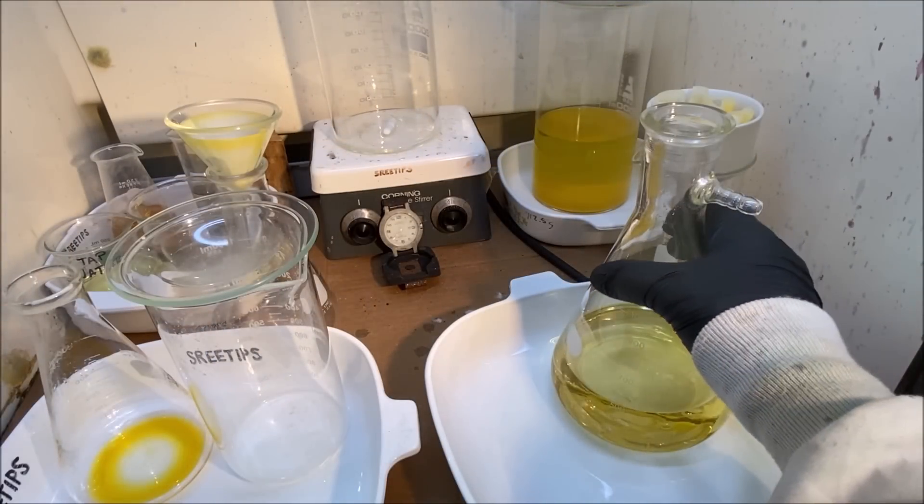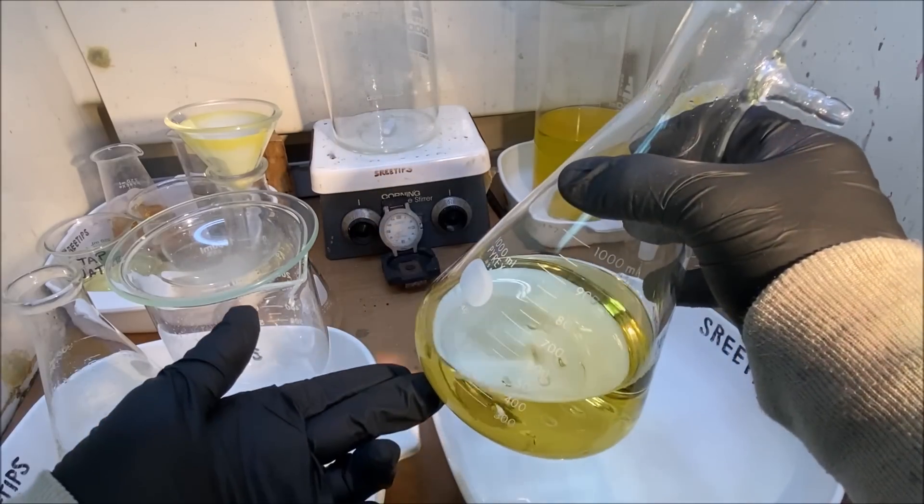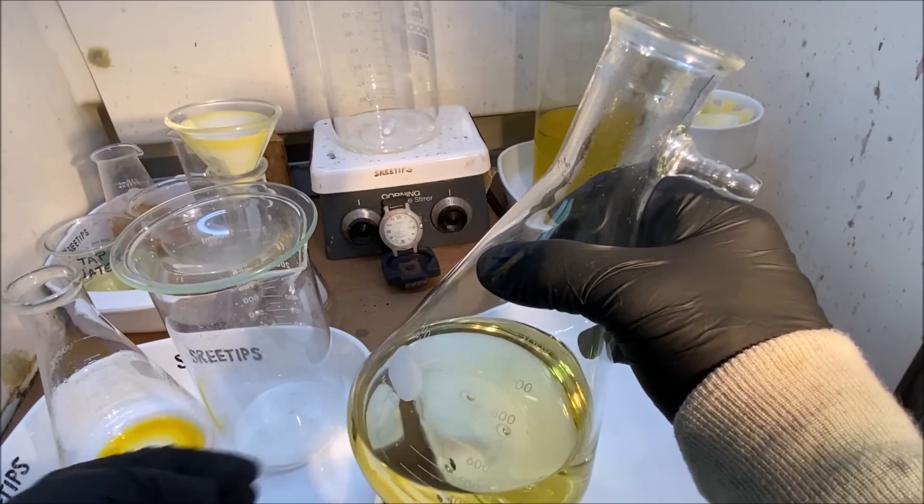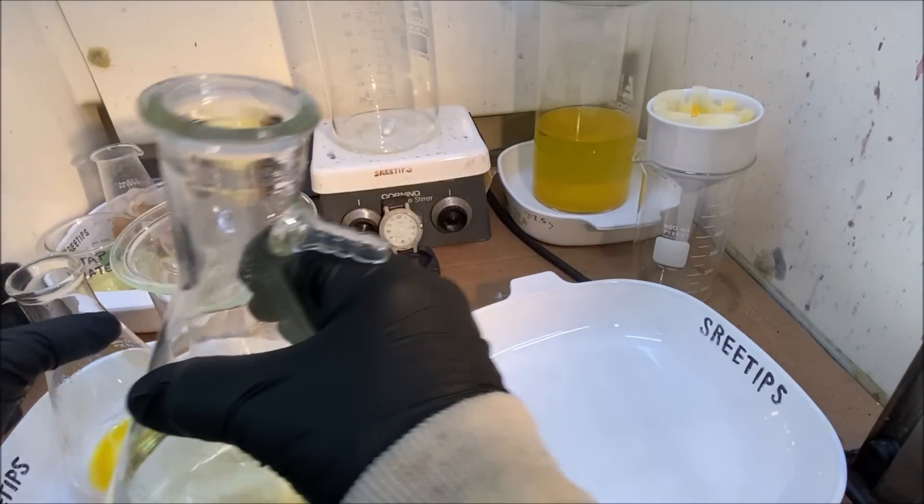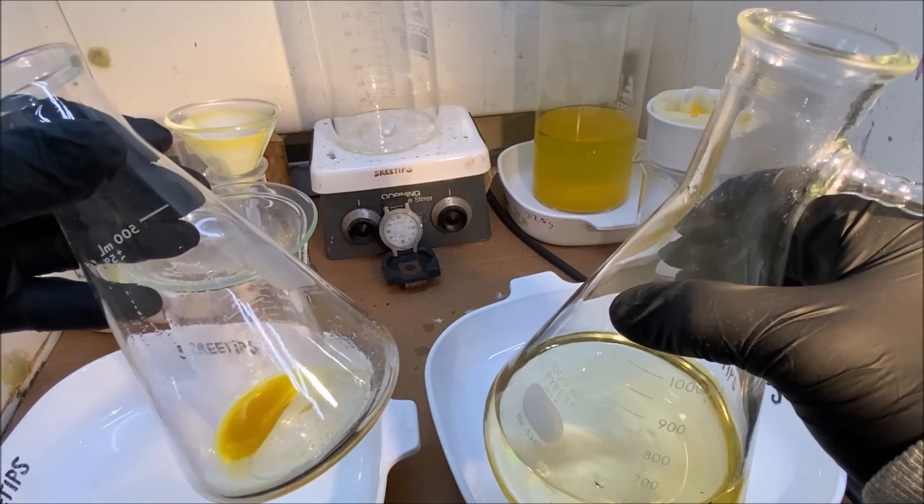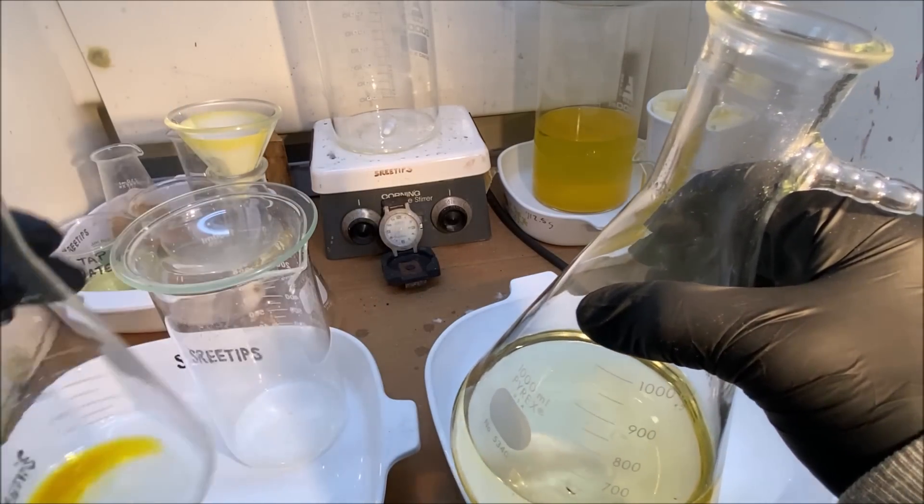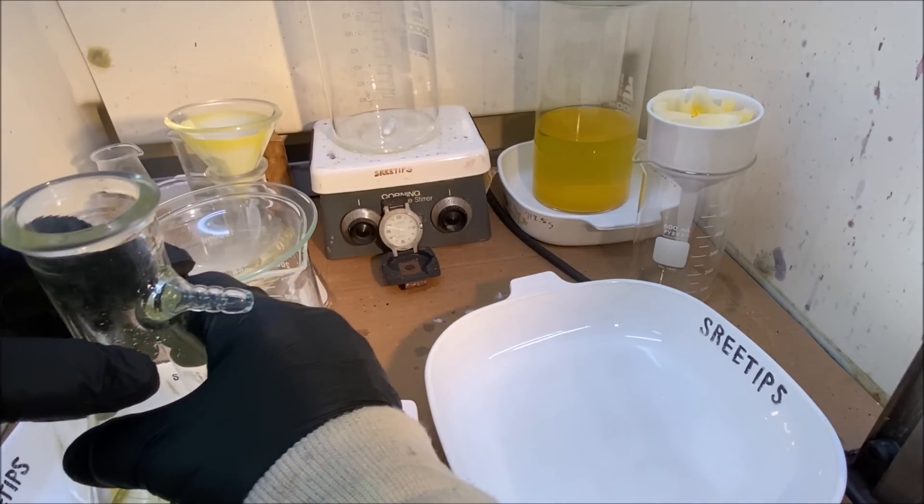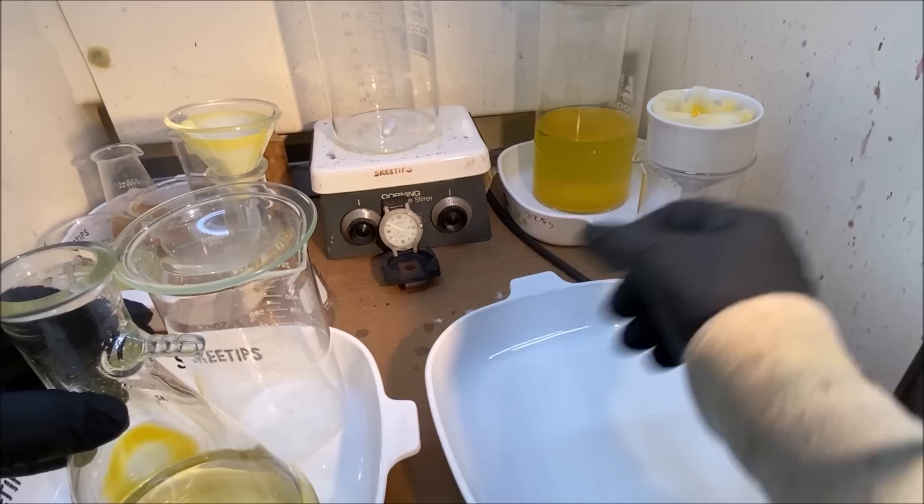We're getting late here. This waste solution, I'll put this in my stock pot. This had a little bit of solids down on the bottom of the flask. I'm not sure what that was, but I didn't add it. So we'll put that in the stock pot as well.